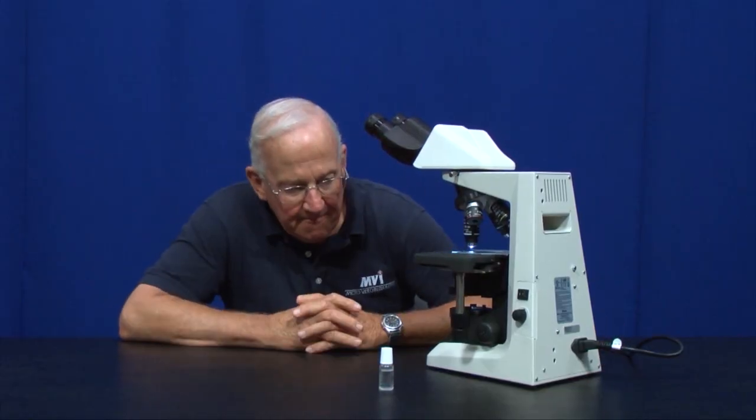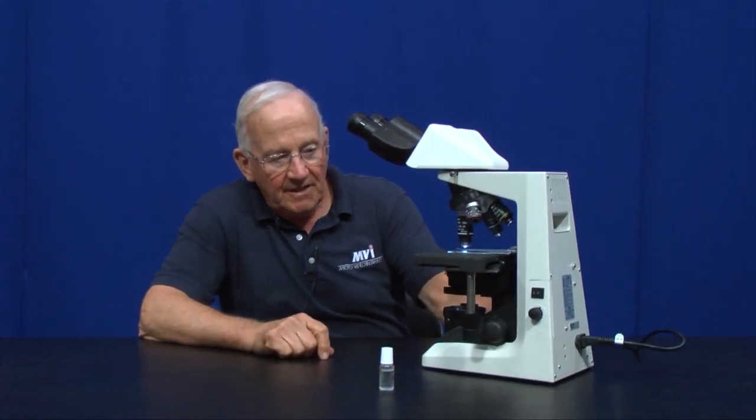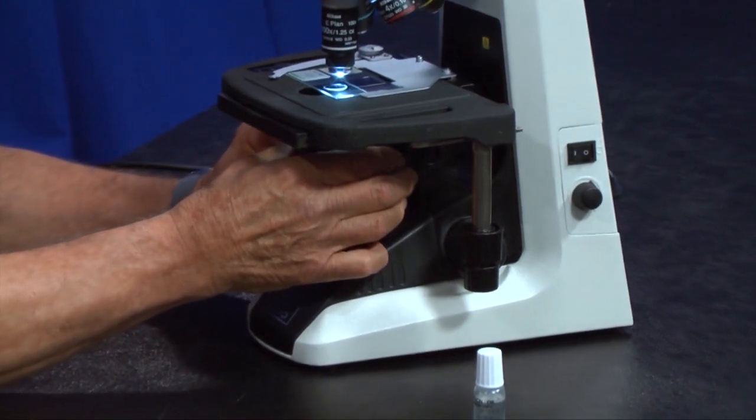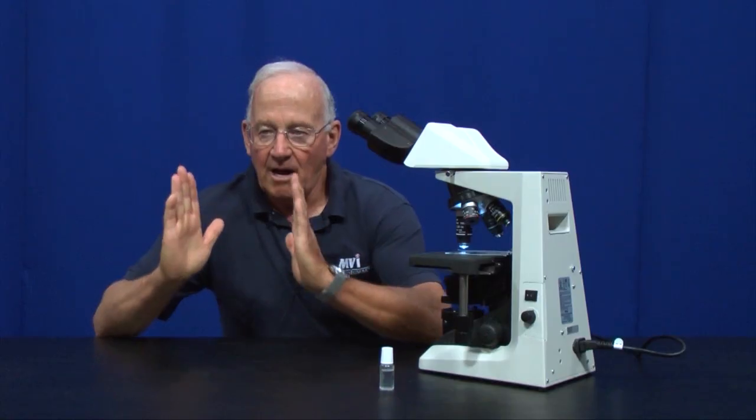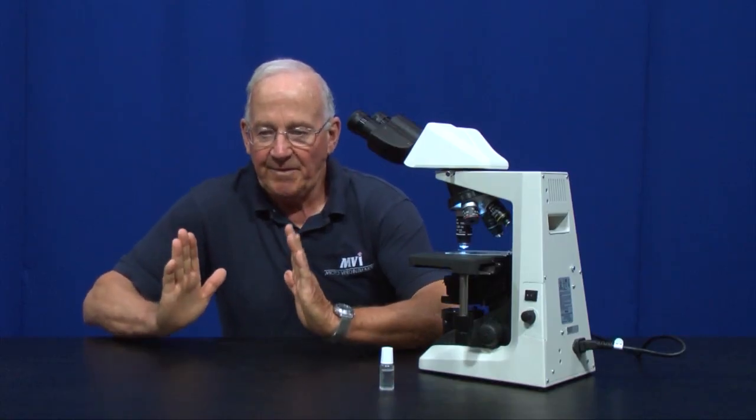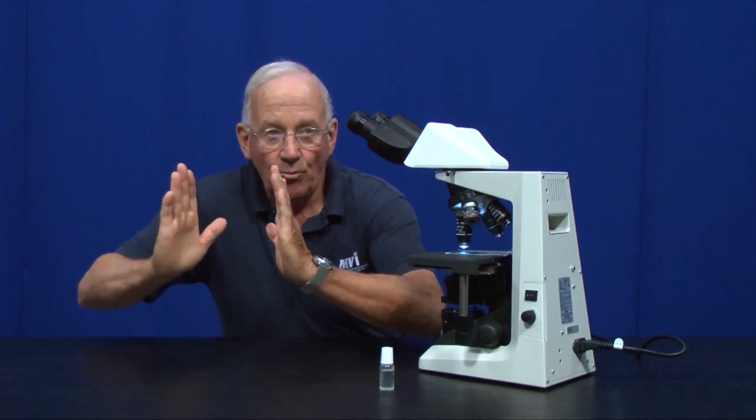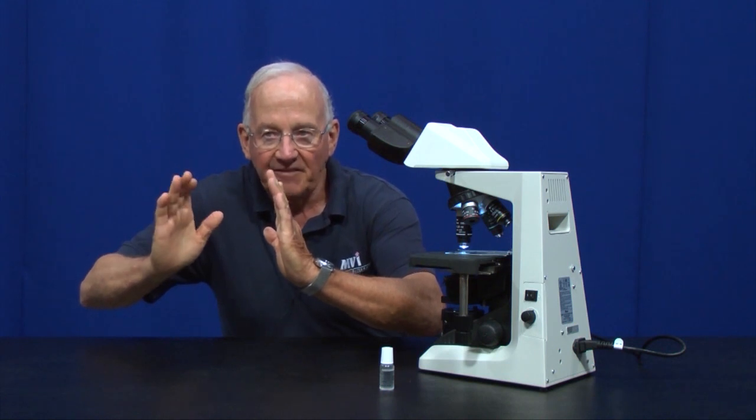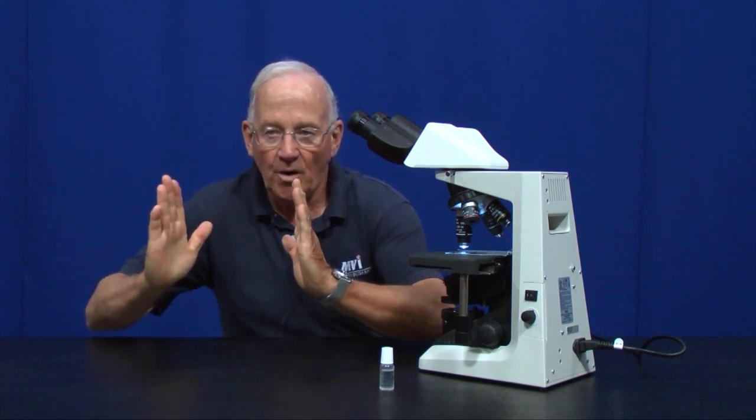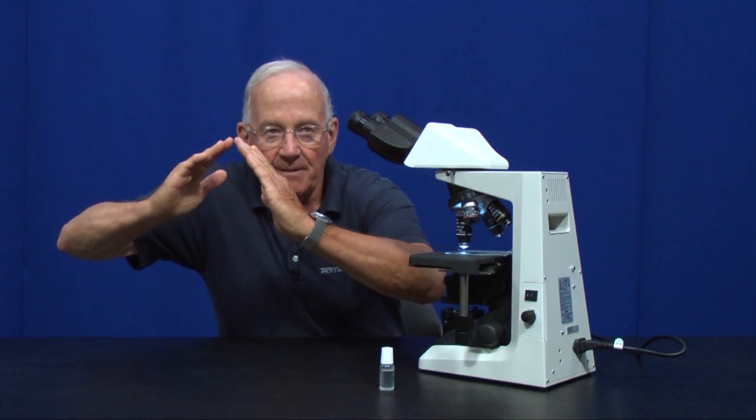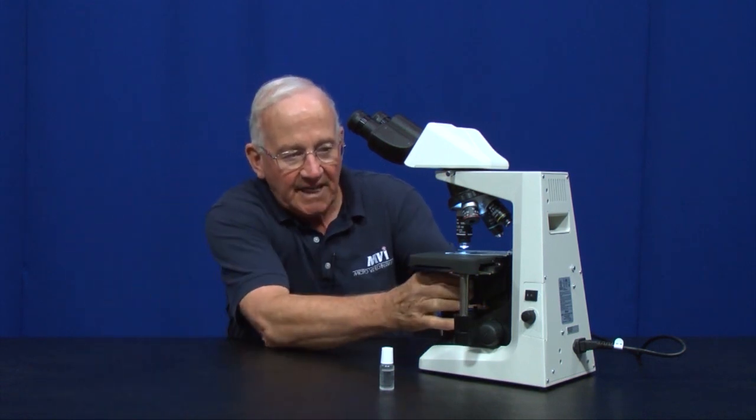I'm going to go on to the condenser of the microscope, and it's a good name for it because what it does is takes a beam of light that would be coming up like this. Maybe you could use that beam of light with the 4x objective, but with the 100x objective that has a very small lens, you want to condense that light into the objective like so. That's what the condenser does.